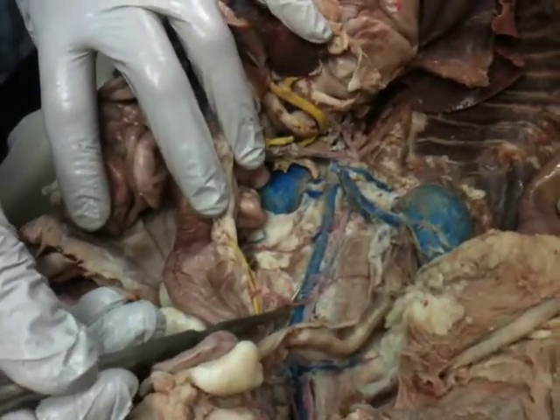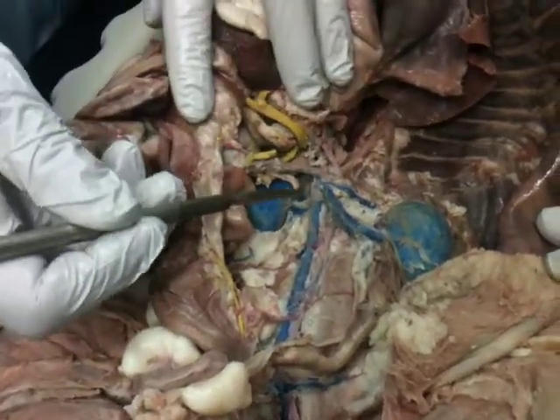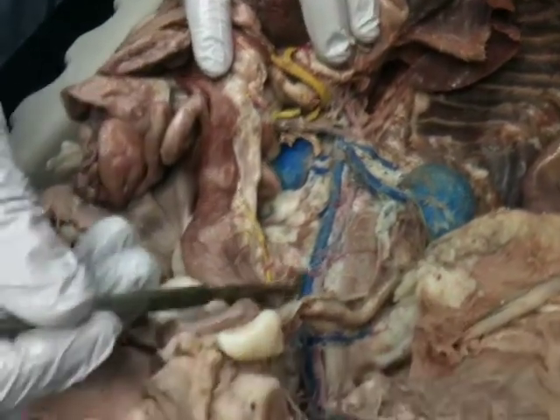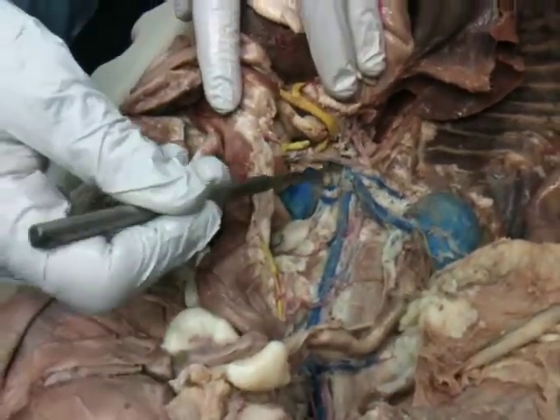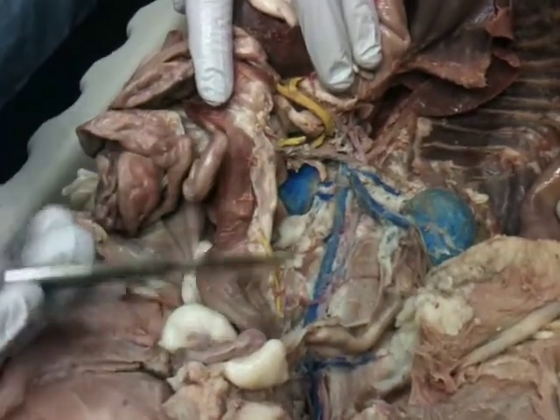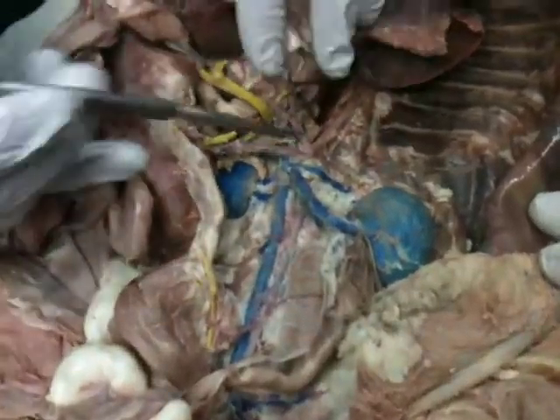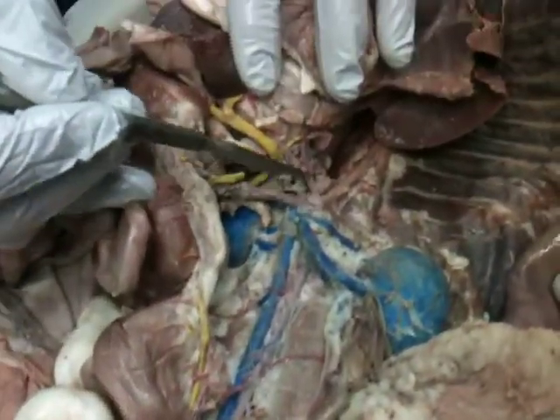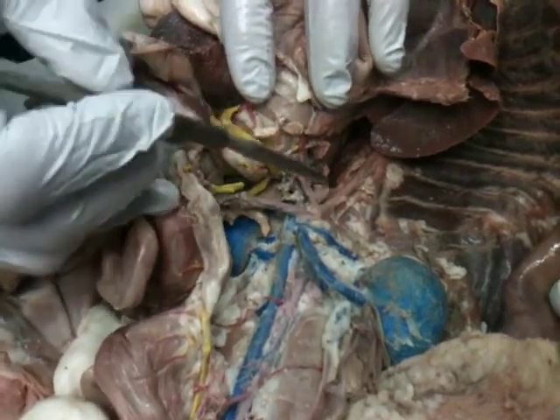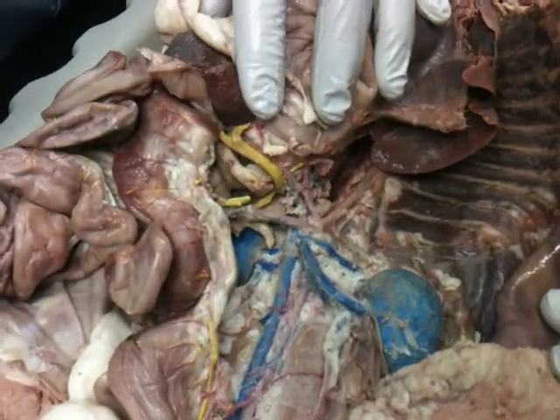Again, always designate artery from veins. Okay. You will also hear cranial mesenteric artery and caudal mesenteric artery. Cranial being of the head, caudal being of the tail, or superior, inferior mesenteric arteries. On our more superior one, which is the celiac artery, few branches come off of this one. Hepatic, gastric, and then it goes to the splenic.